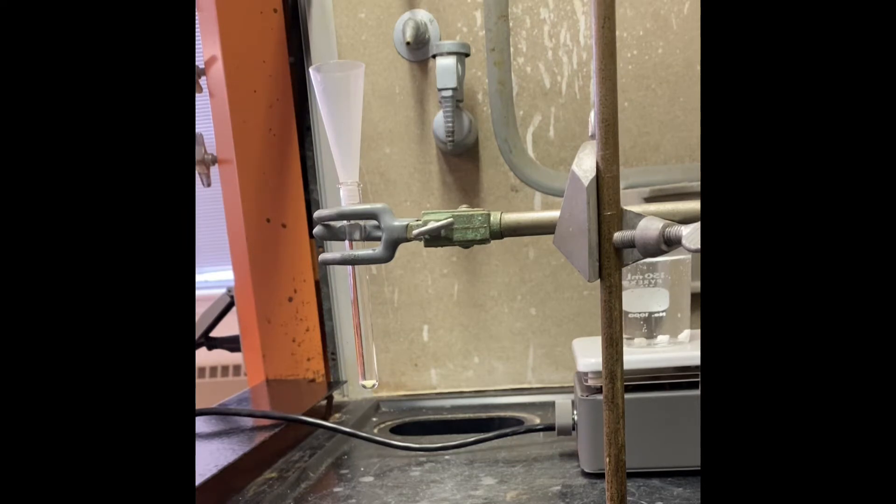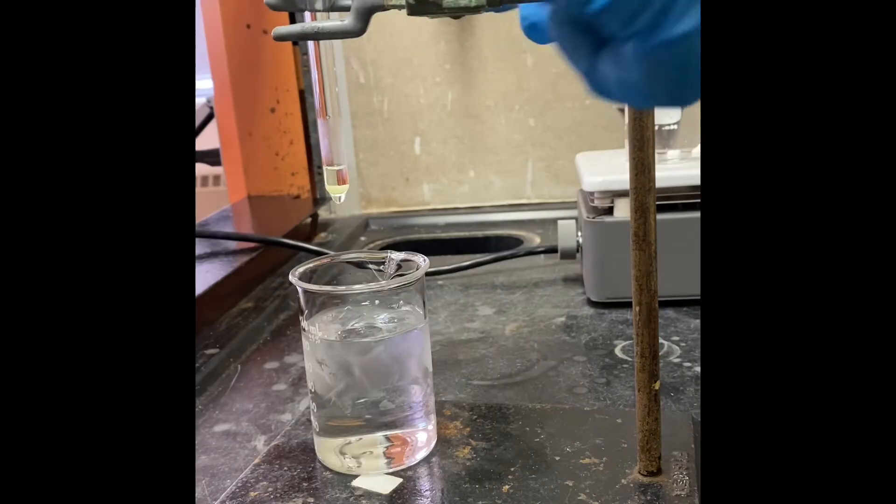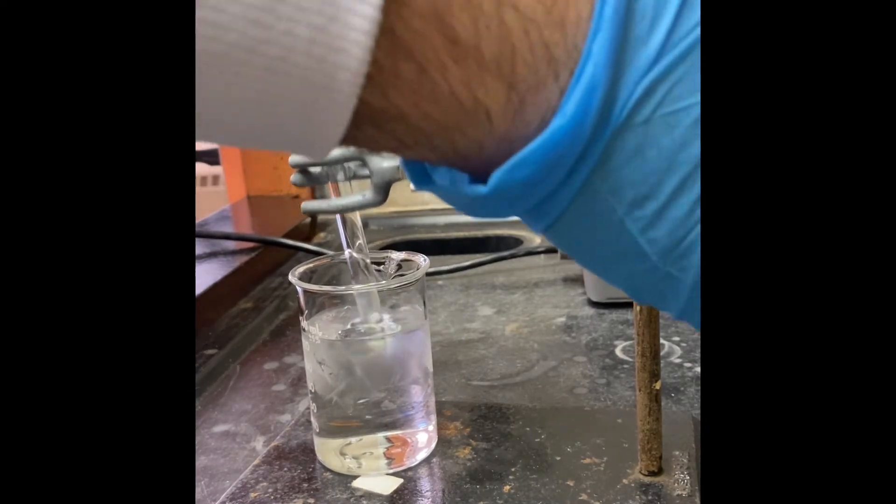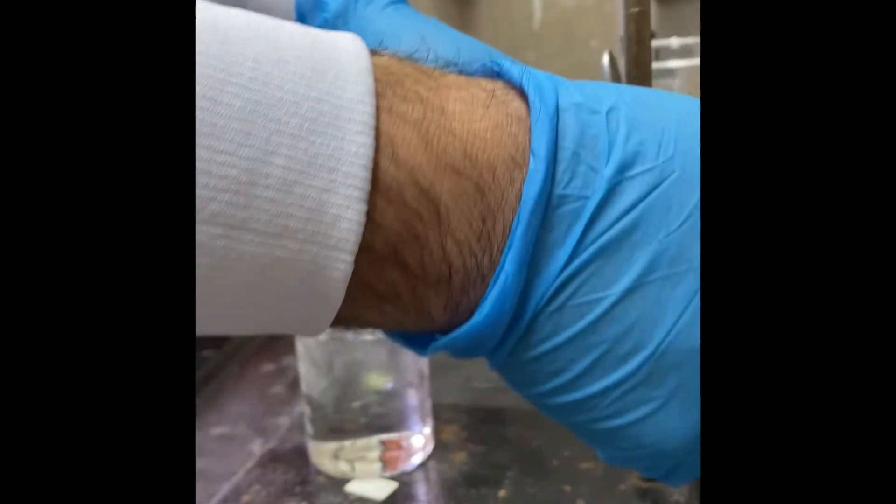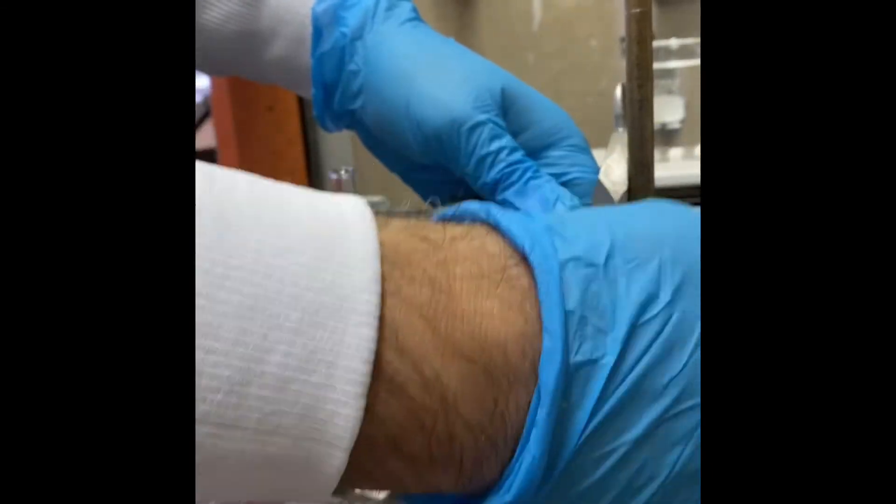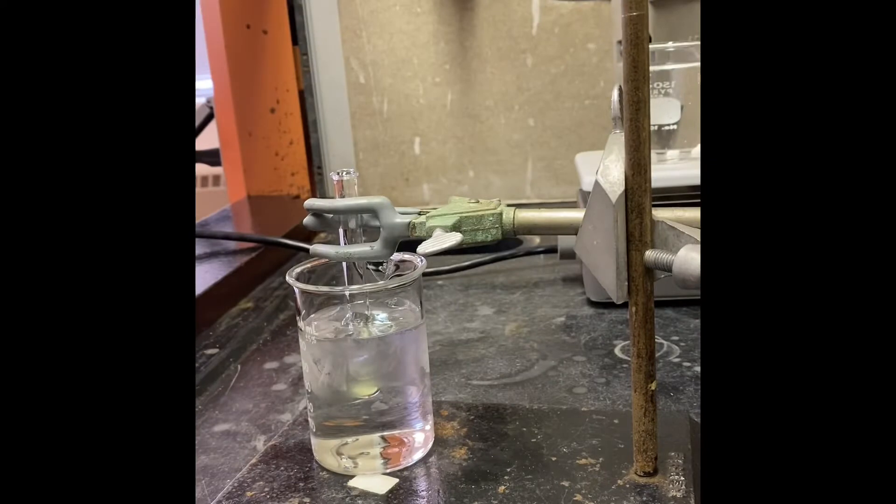Now I'm going to put it on an ice bath, let it cool down, and then after I will add 10 milligrams of sodium borohydride.